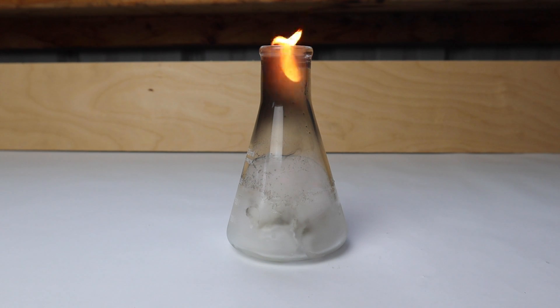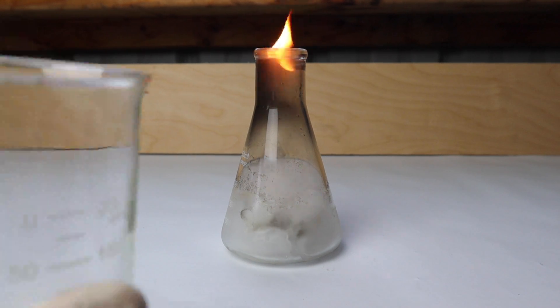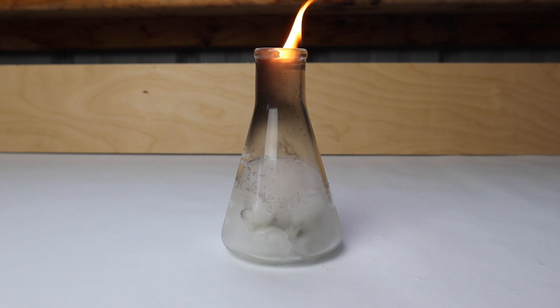So you can pretty clearly see that the acetylene gas has lit on fire, but it doesn't necessarily look like the ice is on fire. So I'm going to transfer it into a beaker and hopefully we can get a cooler looking reaction from that.